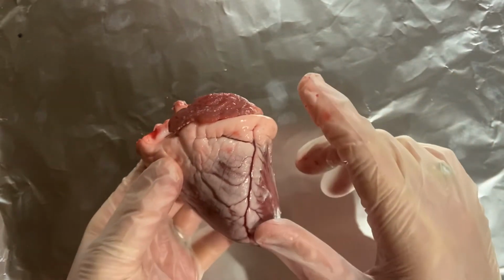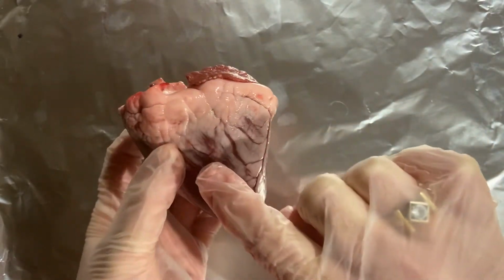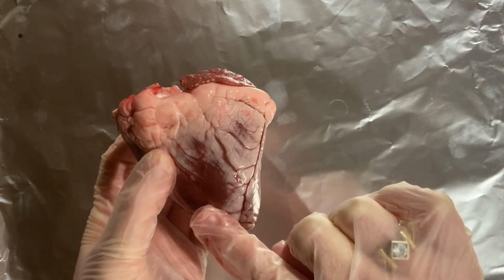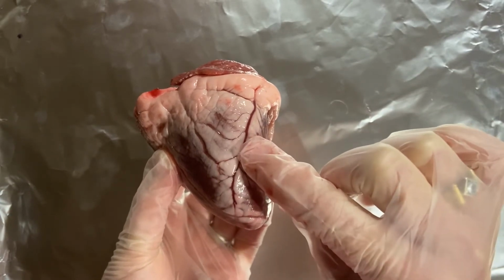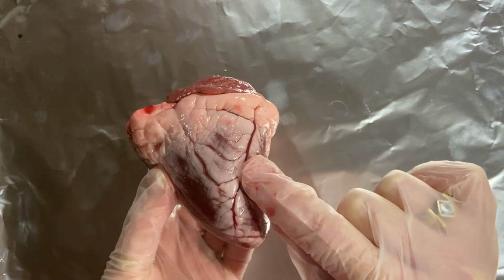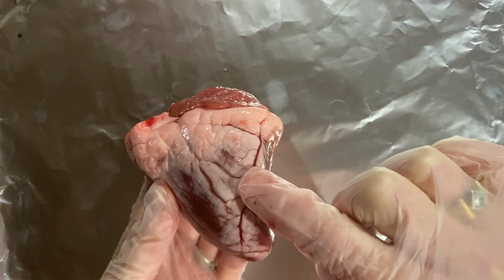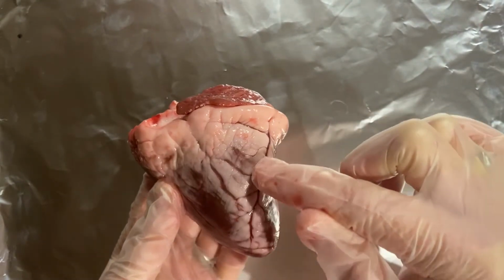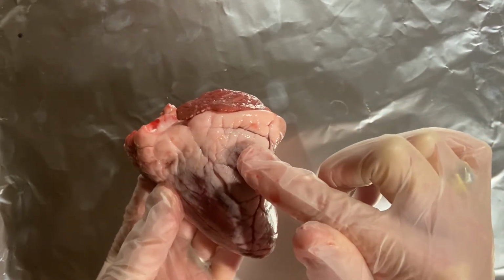Now, what we sometimes forget is that the heart itself has got a network of blood vessels to give this amazing cardiac tissue some oxygen as well. And it is when one of these little blood vessels over here becomes blocked that you get what we call a myocardial infarction. Now, that's a fancy name for a heart attack. When that blood vessel is blocked, it means no oxygen can travel to that part of the heart tissue, causing it to start to die.